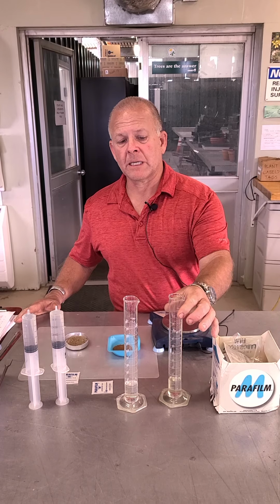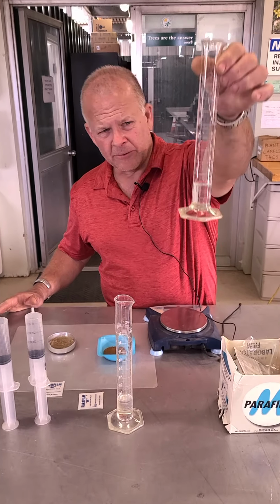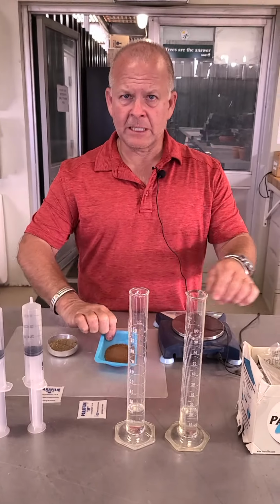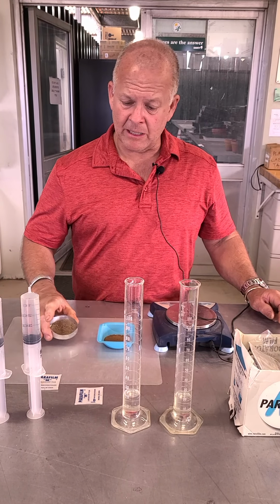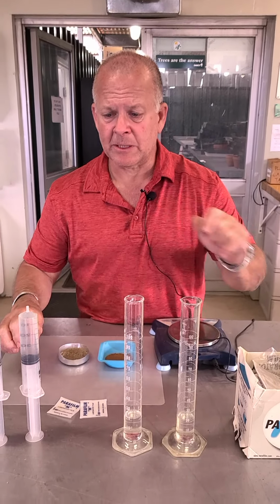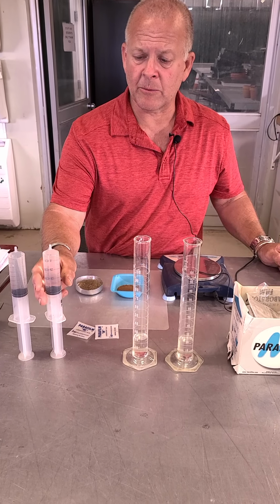All right, so what I've got in front of me while we were off, I went ahead and measured out exactly 20 mils of water. We're going to run two samples. 20 mils of water. I don't know if you can see that. I put a mark down there so it's accurate. 20 mils and 20 mils of water. I've got two samples here, exactly 20 grams of soil. They're the samples we've been using all along here. I've got some parafilm, which I'll show you how this works, but I'm going to seal these tubes and tap them, making sure I don't spill anything or lose any soil or water.